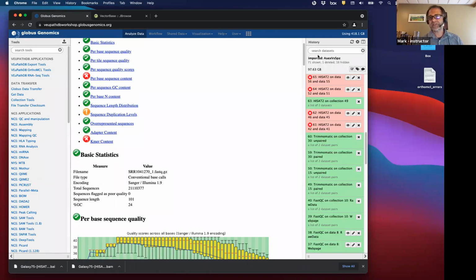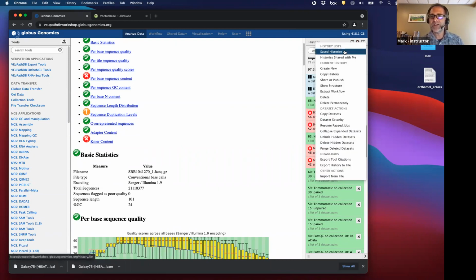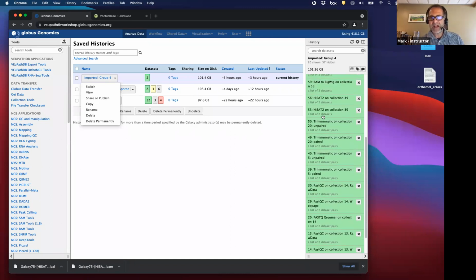So we're still at FastQ, and now we have our FastQ, and we know that they look good from the FastQC report. We've trimmed poor quality bases from it. Now we're ready to do alignments. And this one failed, but I'll switch to another one. And here I'm at the HISAT.